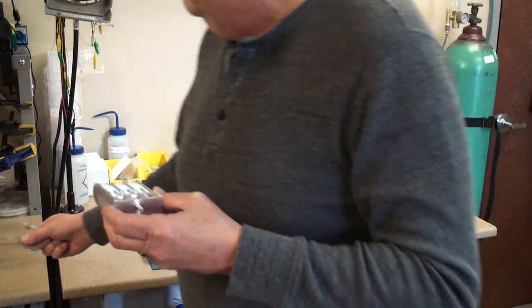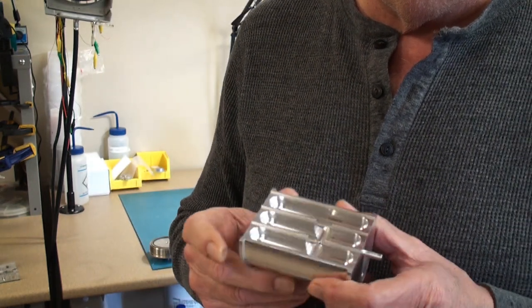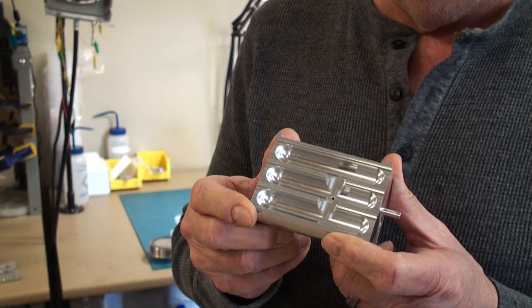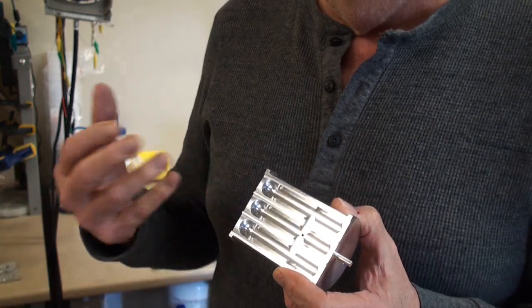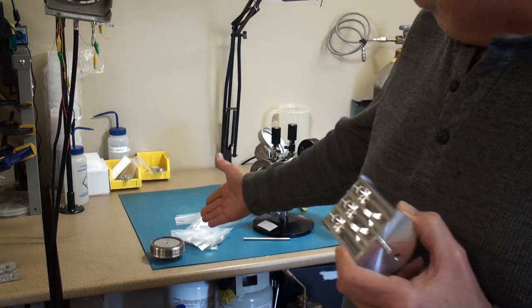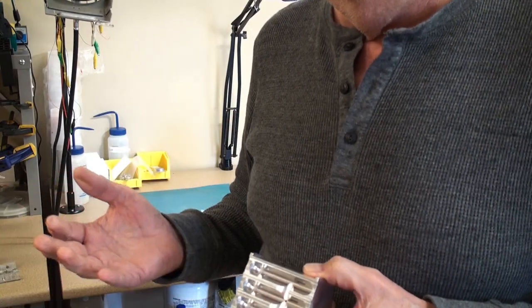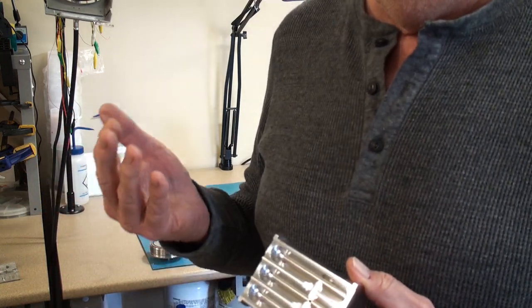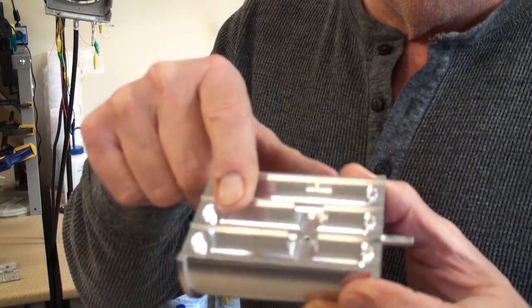You just may want to layer samples in these grooves in the device but you have the ability to put them in these baskets. Now critical point drying requires not only the use of CO2 but an intermediate fluid. Usually it's ethanol because that's what you dehydrate your sample in. Some material science users may use some other compounds. If you're going to use acetone I'll just let you know that it has special gaskets in it like the O-ring on the back that is acetone resistant.